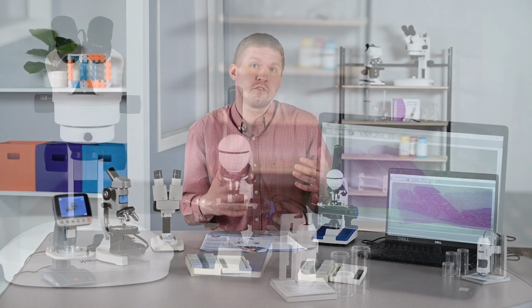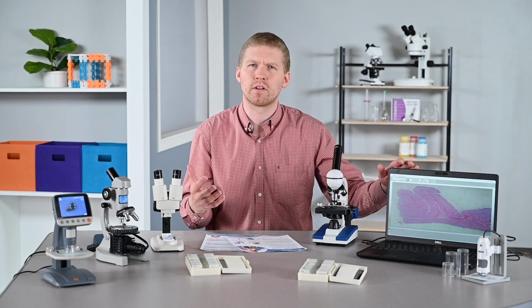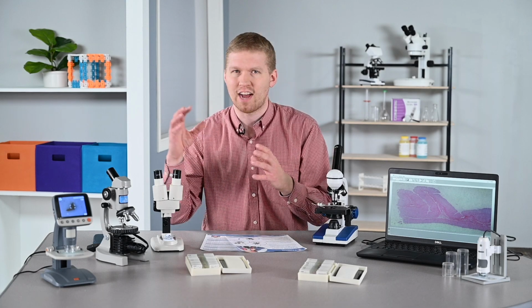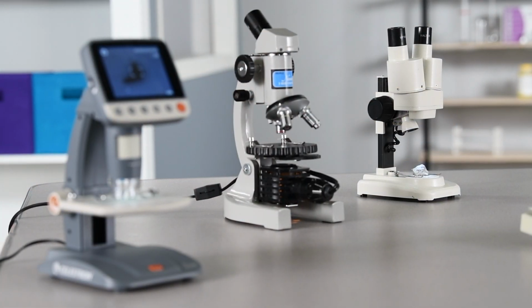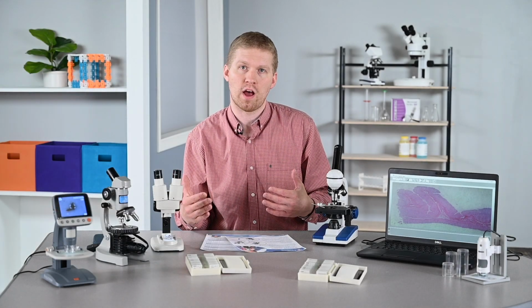There's even an alternative to traditional microscope, which is having a digital one. They work very similar, but some have a handheld, some are accessories that attach to the top of the microscope, and then also some have LCD screens that you see right here. They are kind of like built right on them. These are great alternative options if you're looking to create a video where students speak to what they're seeing, or if you want them to label parts of the object they're viewing.